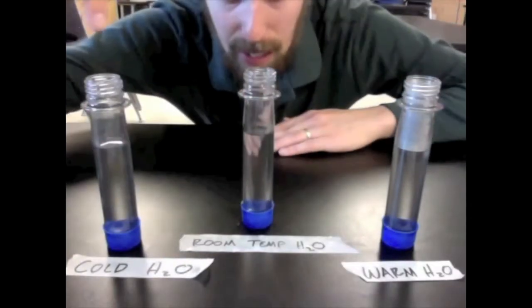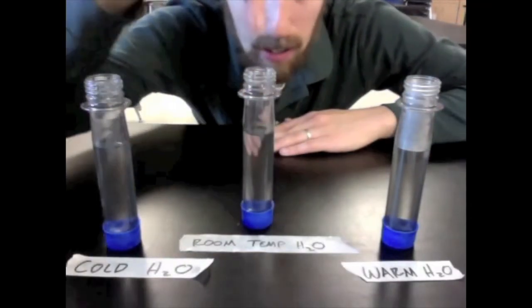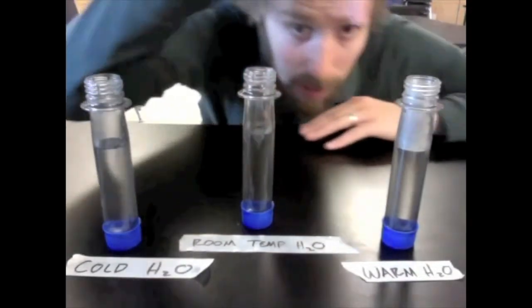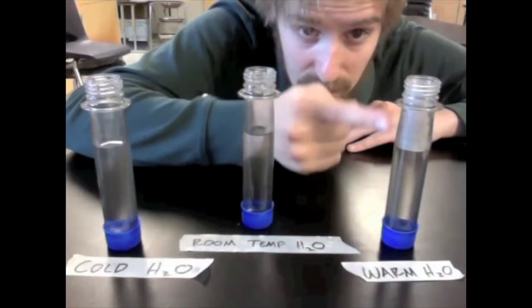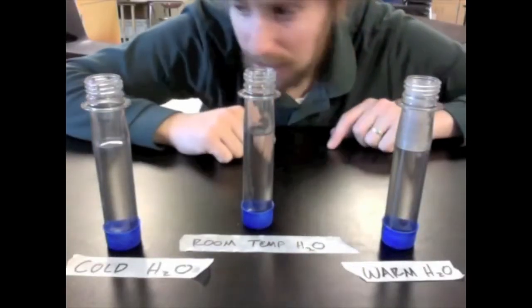Here we have got our cold water trial, our room temperature water trial, and our warm water trial. You can tell this one's the warm water trial because of the steam in this part of the test tube.